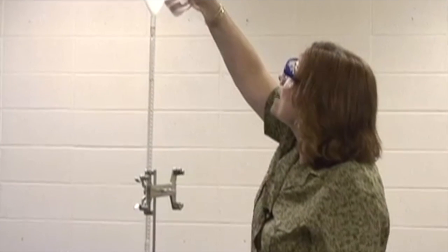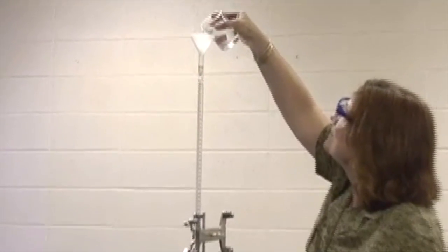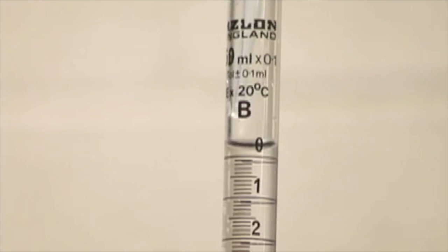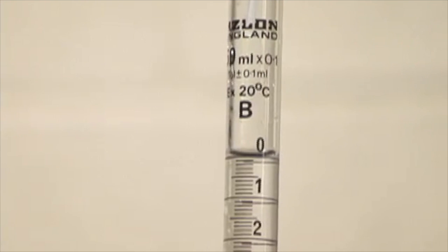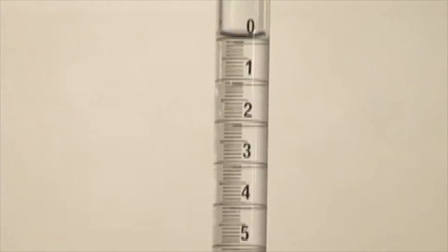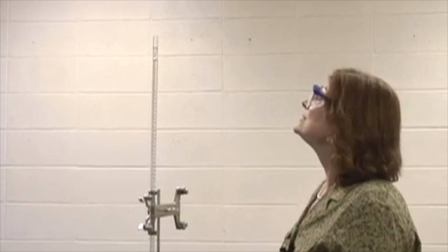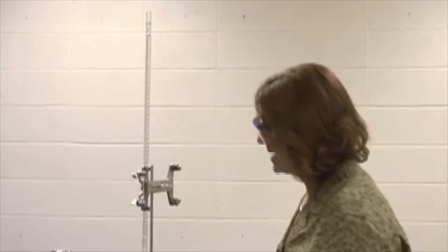Now we have to set up for the second time. I'm going to refill my burette with my unknown concentration of the base. I'm using a funnel in the top, and I'm going to pour it to get back to 0, which allows me to subtract much more easily. And I see that I got a bit too much, but that's okay because I'm going to use an eyedropper. Be careful, some professors don't like us doing that. They would rather us control from the bottom, but I find for my purposes that I use an eyedropper, and I make sure that I do not place materials back into any container whatsoever. It must either go into a waste container or into the sink, not back into my original container. So now I'm back up at 0, which allows for a simple subtraction.